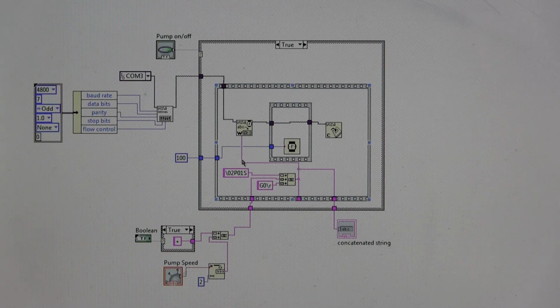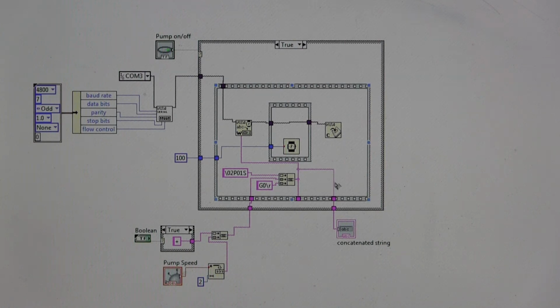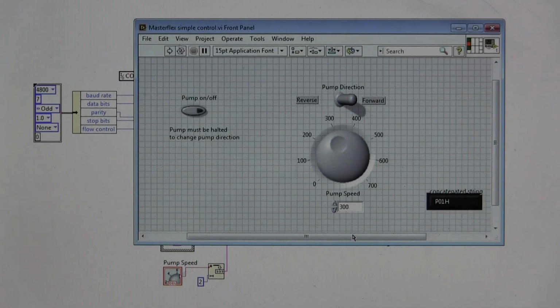All of that is what is brought to the VISA Write command, and again it writes it to the pump. We have a delay and then we close the connection. The other interesting thing though is we have this concatenated string, and this is really just for debugging so that we can see what's going on. So we'll right click on that and find indicator.